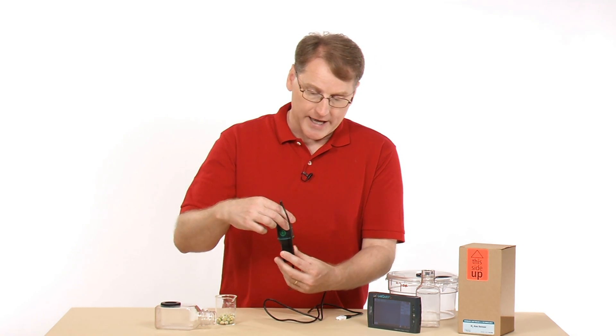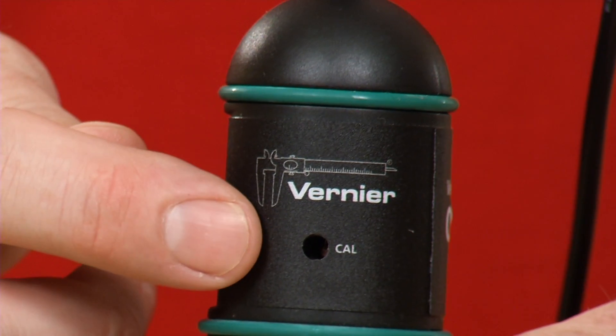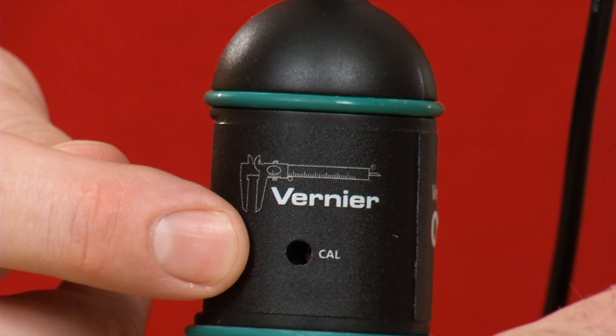It is possible to calibrate the sensor, though you probably don't have to. The sensor booklet will tell you how to go about doing that.